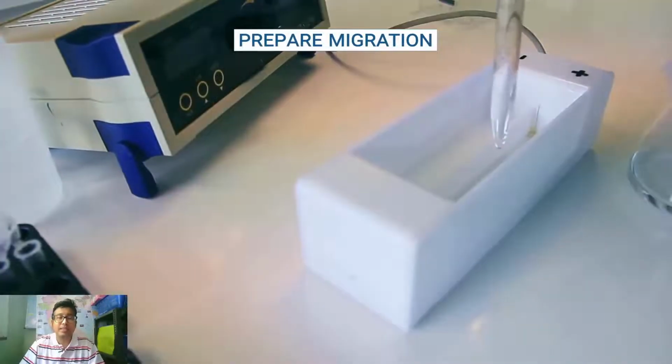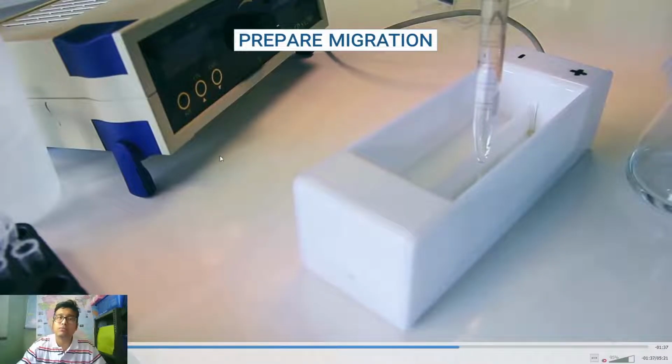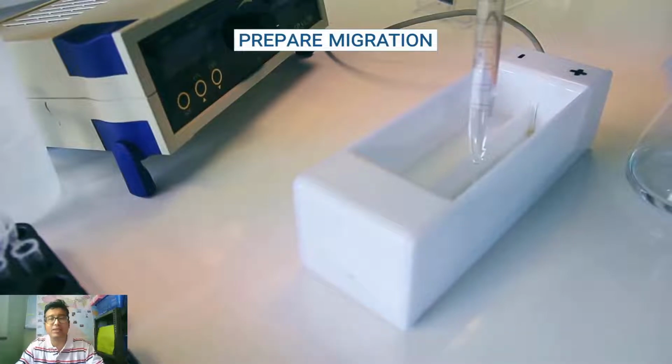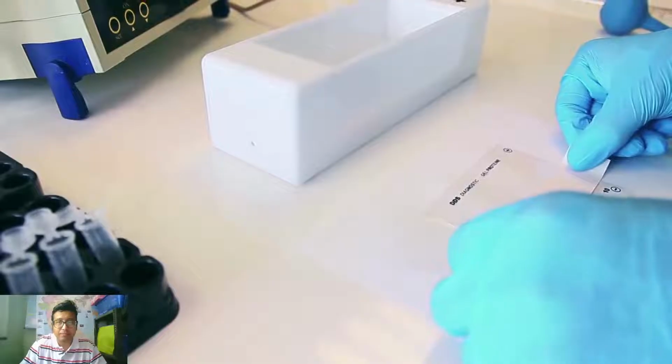Now see, this is the electrophoresis chamber. This is a very short chamber. Okay, it is not a big tank, but this is the mini tank. So what they will do over here, see, this is a positive electrode and this is a negative electrode. They will simply fold the gel in a U fashion so that the circuit is completed. So right now they are pouring buffer into the electrophoresis tank.